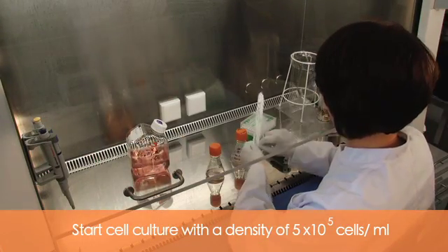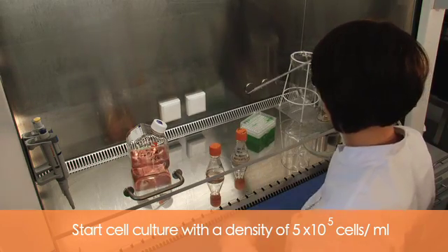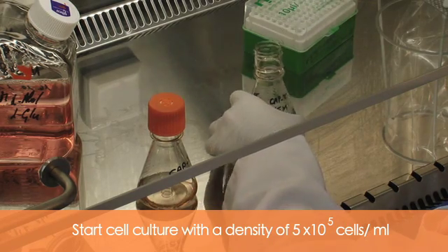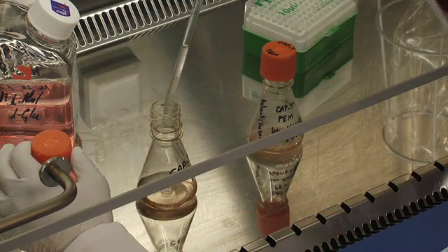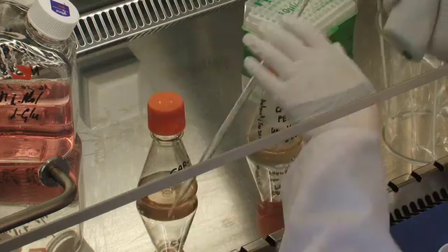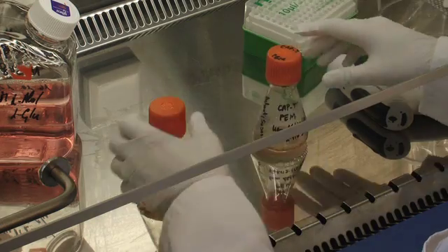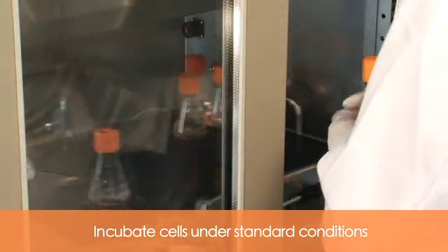Your cell culture of CAP cells should be started with a density of 5×10⁵ cells per mL. Incubate the cells under standard conditions.